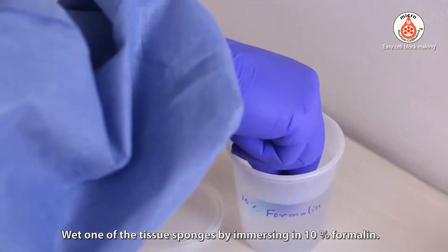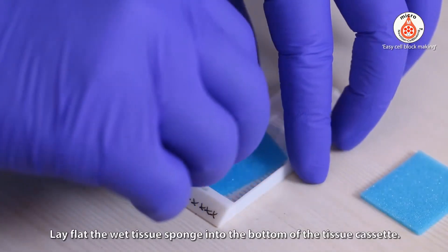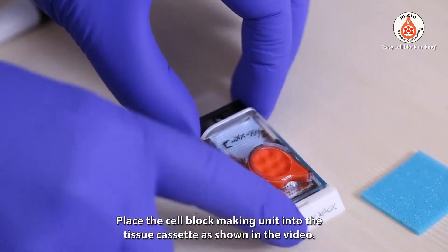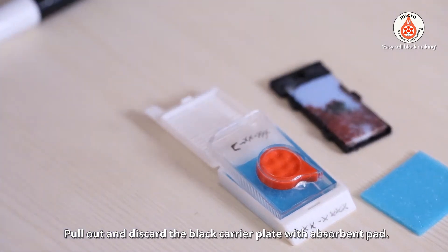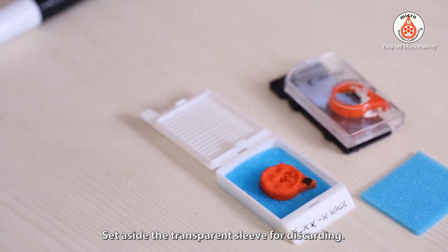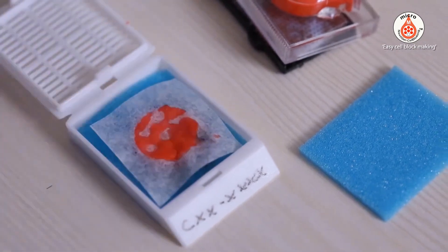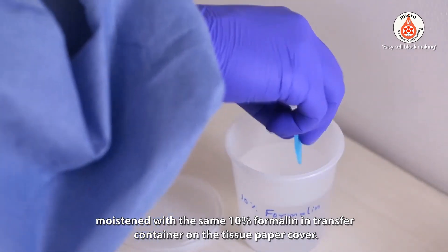Label the tissue cassette. Wet one of the tissue sponges by immersing it in 10% formalin, then lay it flat into the bottom of the tissue cassette. Place the cell block making unit into the tissue cassette as shown. Pull out and discard the black carrier plate with absorbent pad. Dislodge the sponge disk with the help of a pipette tip if needed onto the wet tissue sponge. Set aside the transparent sleeve for discarding. Put a tissue paper cover on the sponge disk, then place the second tissue sponge moistened with 10% formalin from the transfer container on the tissue paper cover.